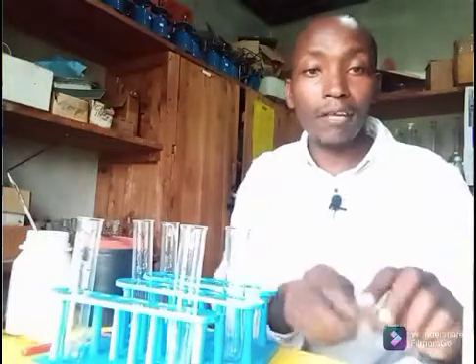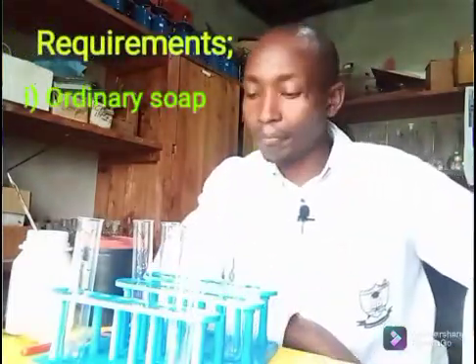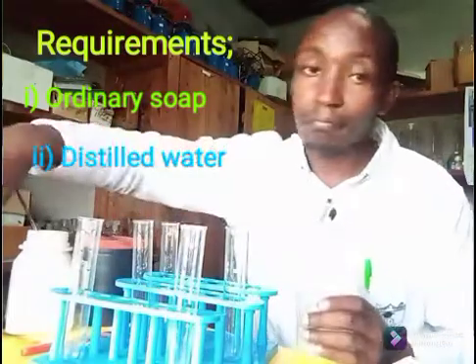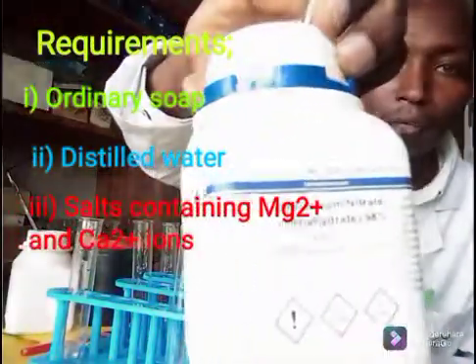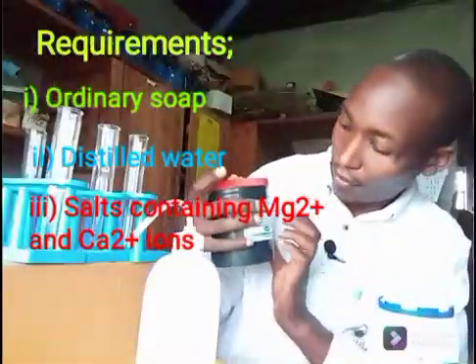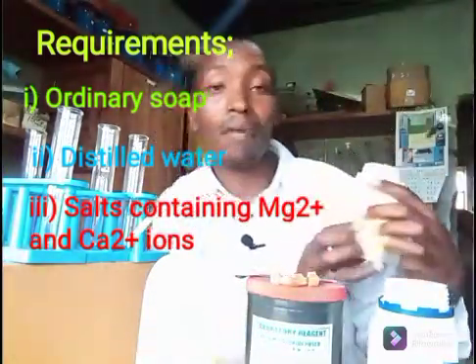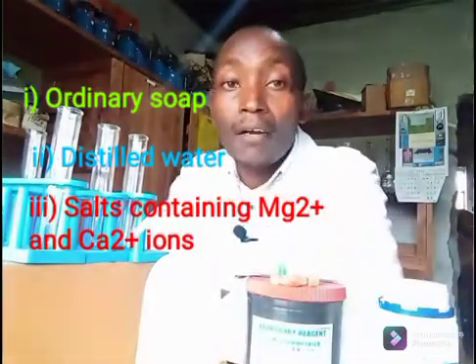I do have some pieces of bar soap, just the ordinary soap. I do have some distilled water. I have some salt here — this is magnesium nitrate, and this is calcium chloride. And I also have magnesium bicarbonate, or magnesium hydrogen carbonate.